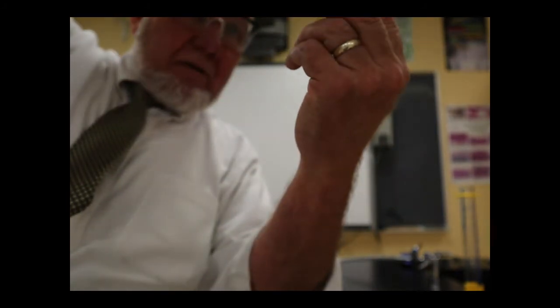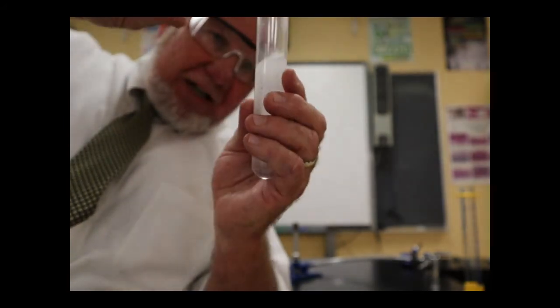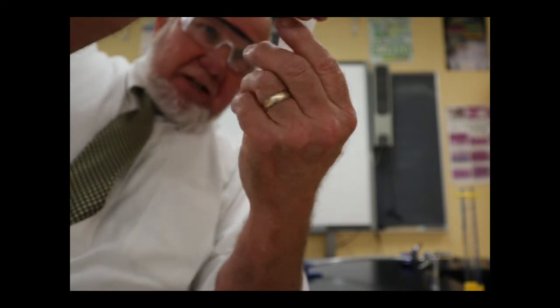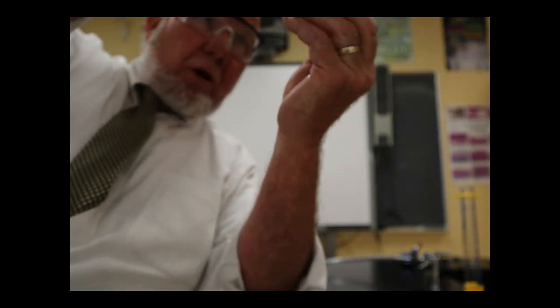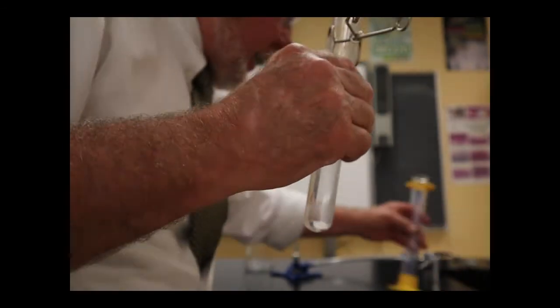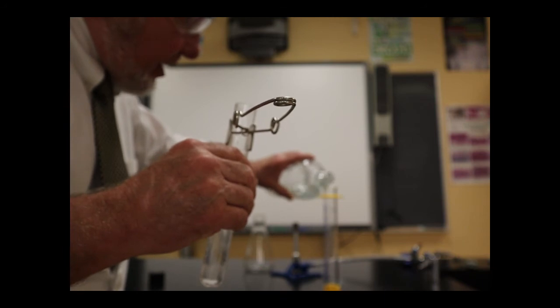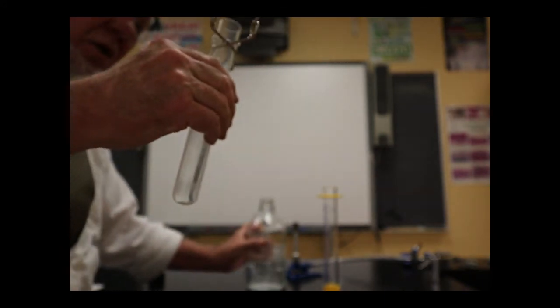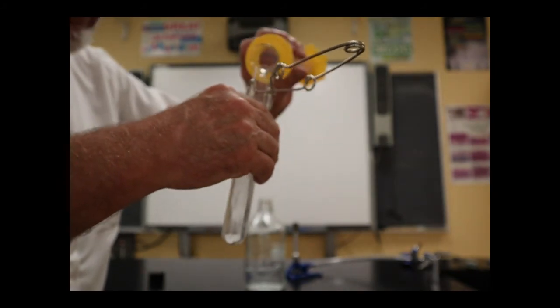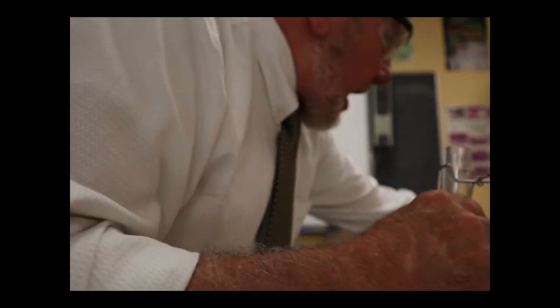And I see that little bit of magnesium. It's just kind of frustrating there. Come on. Sometimes pieces remain. I want to be sure, so let me add just a tad more hydrochloric acid. We want to make sure that we get all of that magnesium to react, because we had 0.25 grams of it, and we want all 0.25 grams of it to completely react.